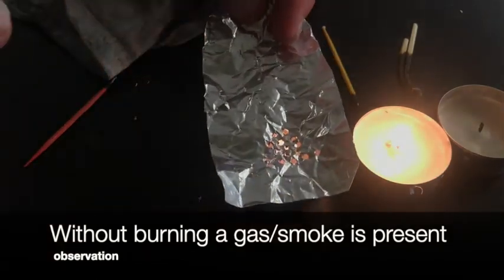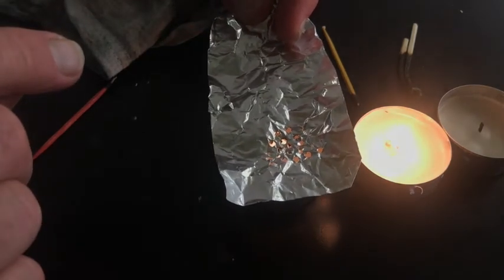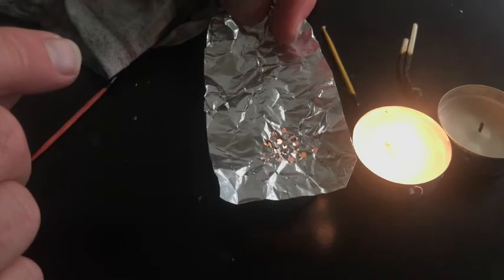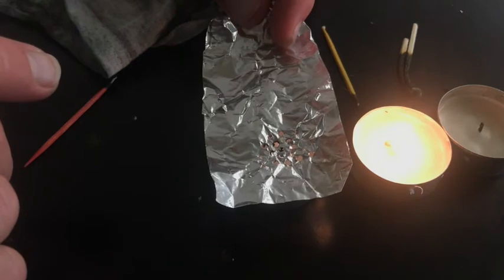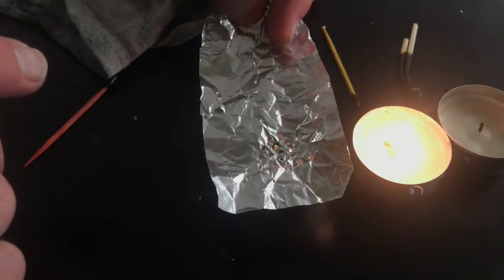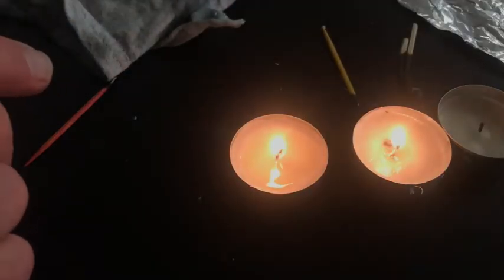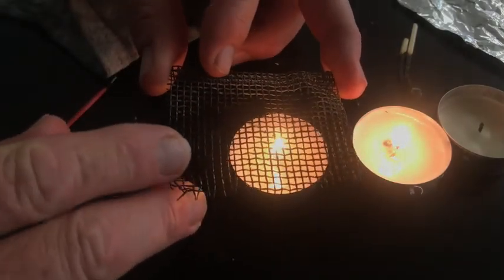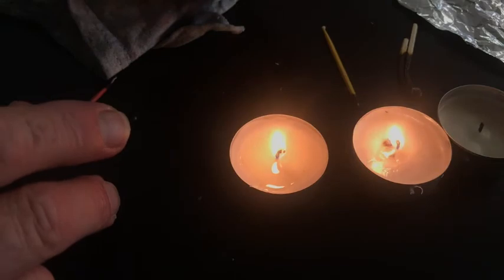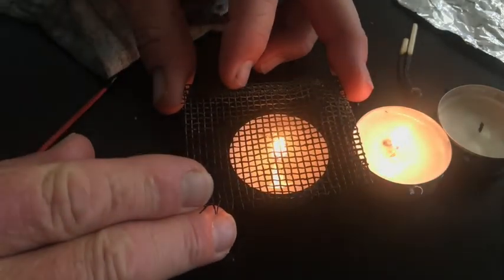And then the second thing I've already mentioned is the smoke that forms when you bring this down. So with this smoke comes an odor, and so not only do I have a smoke, but I have odor coming through. Now, I can see this, but I know what to look for. So I'm going to switch to the screen because I can see more. And I'm going to lower this. Look at that. I ruined my gigantic big flame that was going to be perfect.